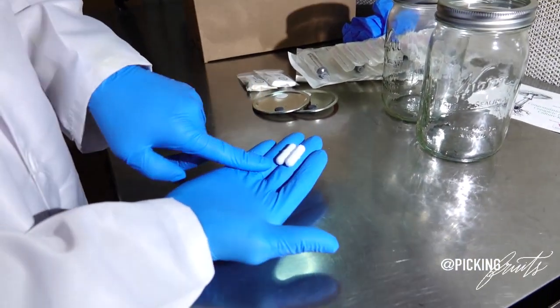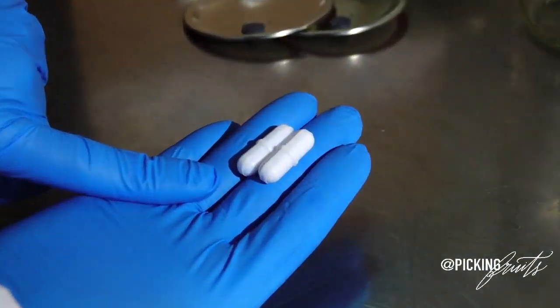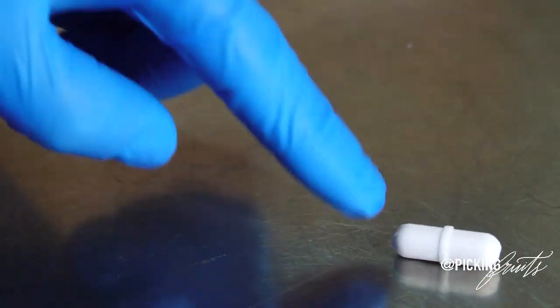The next two items in your box will be these 1 inch magnetic stir bars. They have a bevel in the middle which allow them to spin freely inside of your mason jars.